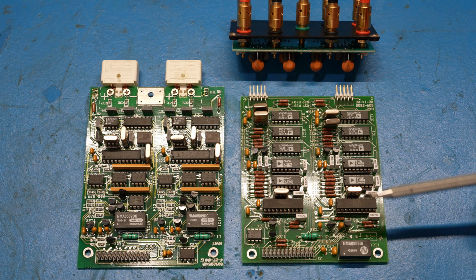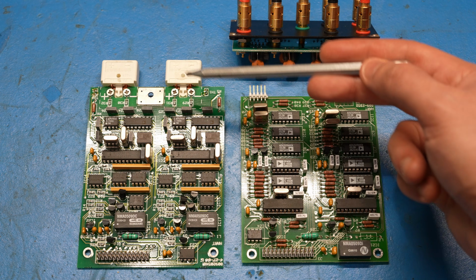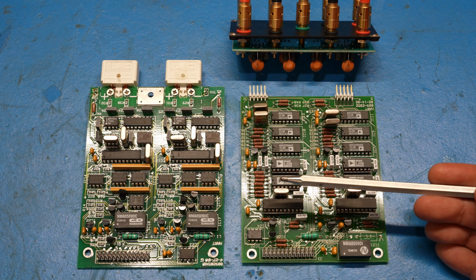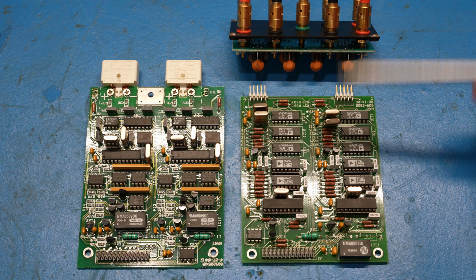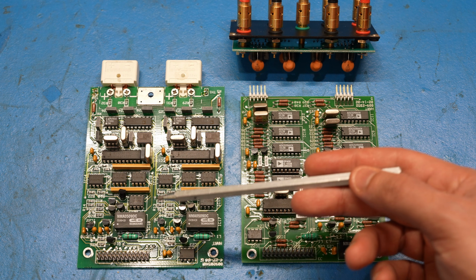But then I looked around a little bit, and I found this one. Now, this module is compatible with the same system, but as you can see, this is thermocouple-based. So technically, I think the firmware is basically the same. If you install this, it'll detect that and treat it like a PRT reader. If you install this one, it should be a thermocouple reader.